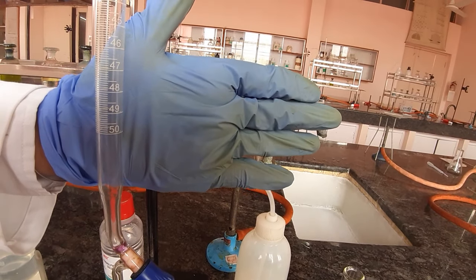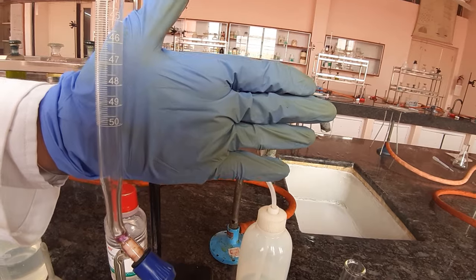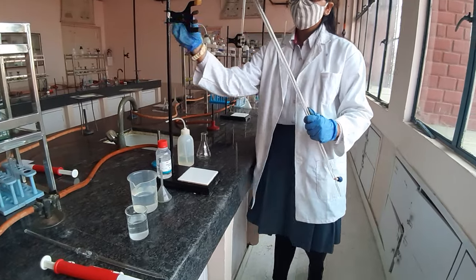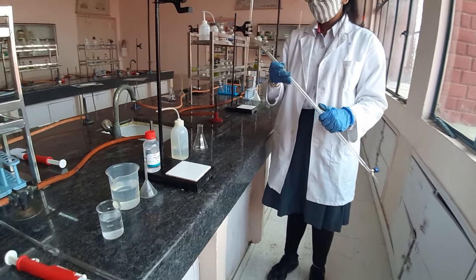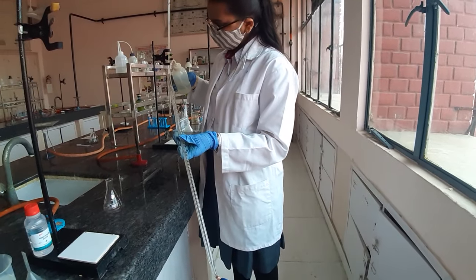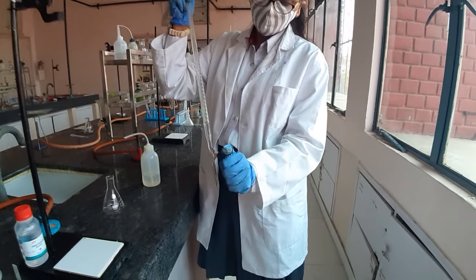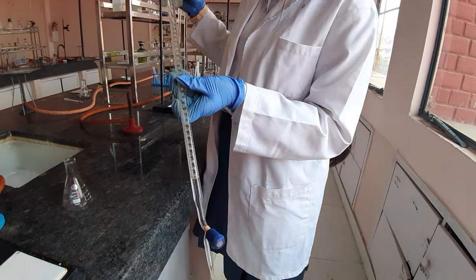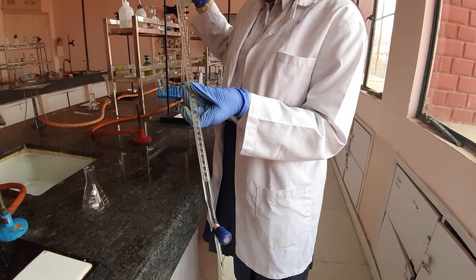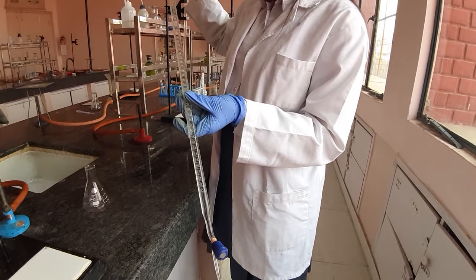The first step required is that you need to clean the burette with water. This is the wash bottle — you need to add water through the top. See that the nozzle is closed so it should not fall off. She has locked it up, so she will add some amount of water to it. She is adding more water and it is rising up.